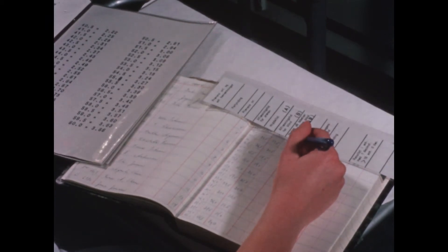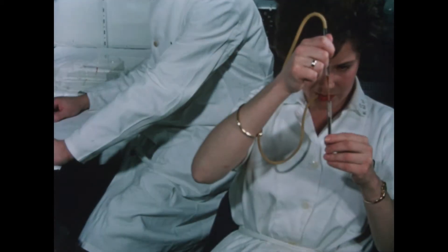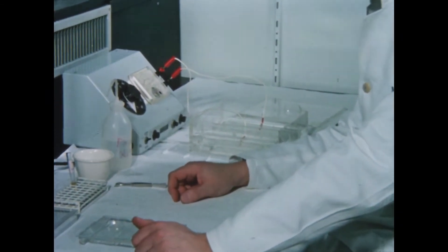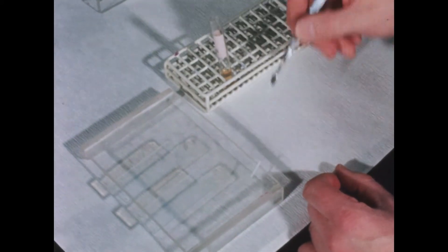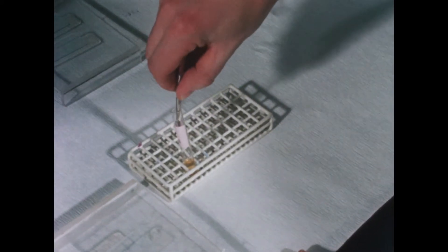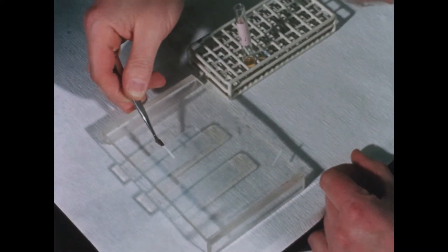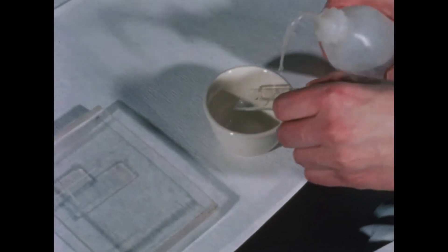In certain cases, it may be of diagnostic value to be able to establish with accuracy from which organ a liberated enzyme is derived. This may be done by enzyme electrophoresis. A piece of filter paper is immersed in the serum specimen, laid on an agar plate which is placed in an electric field to make the enzymes move in the agar together with the serum proteins. Enzymes from different organs have very special rates of movement in such a field.